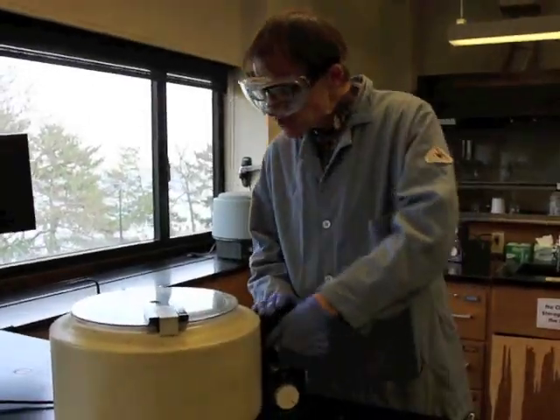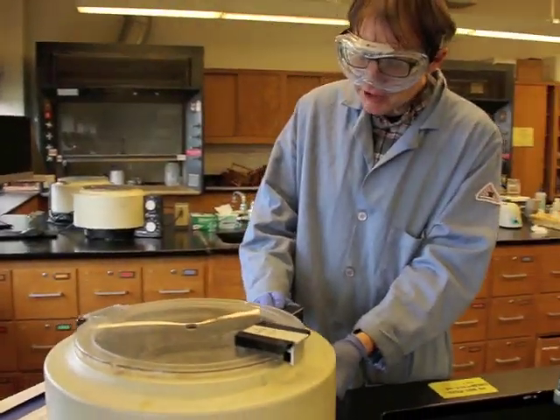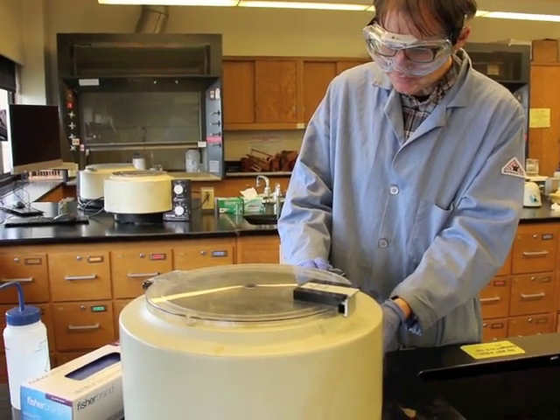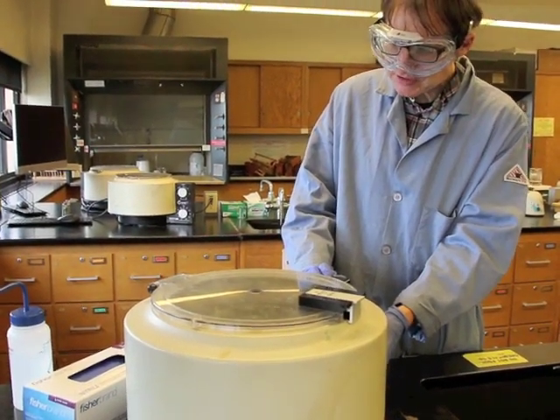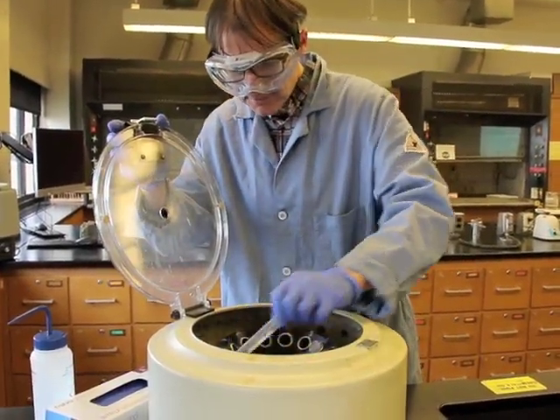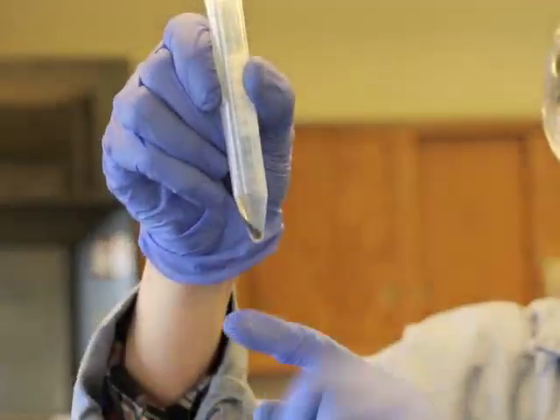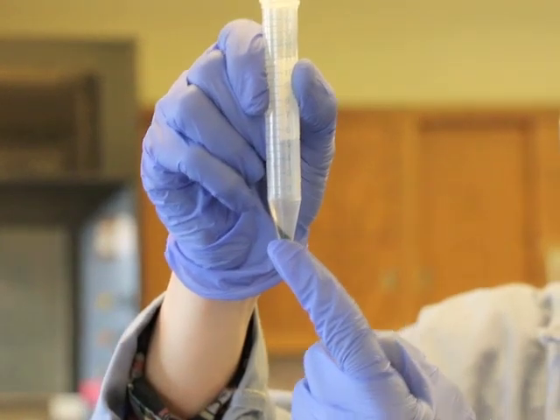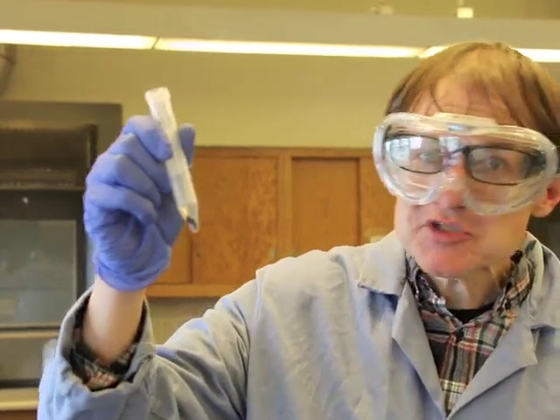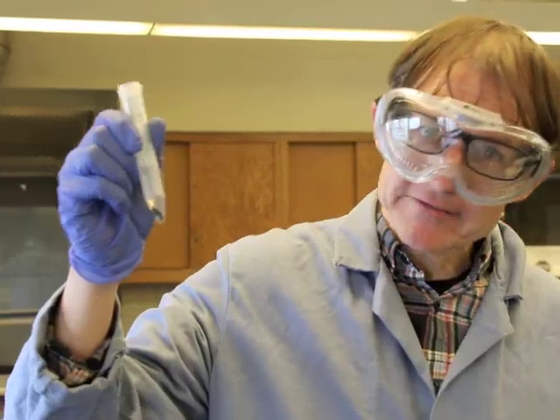Okay, so now we'll stop this centrifuging and we'll see what's going on with the bismuth. If we get a black solid, a black powder down at the bottom, that tells us that we had bismuth in the solution. So let's take a look and see what this is. Take a look there, very nice. See that black solid there on the side? That black solid is indicating that we have metallic bismuth. That means that our known solution has bismuth in it, as we expected. The real test is what's going to happen with our unknown. Will our unknown also have this black solid?